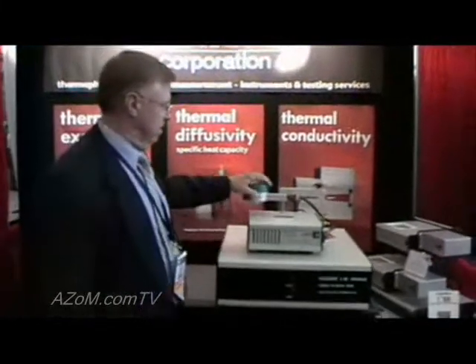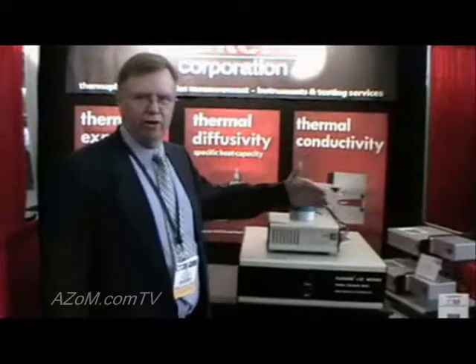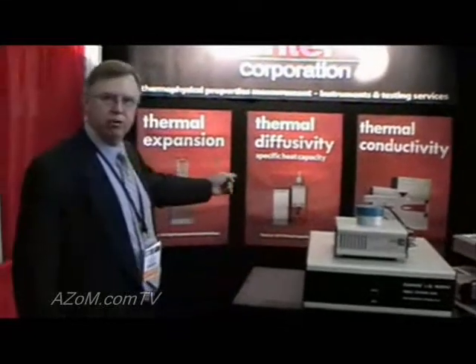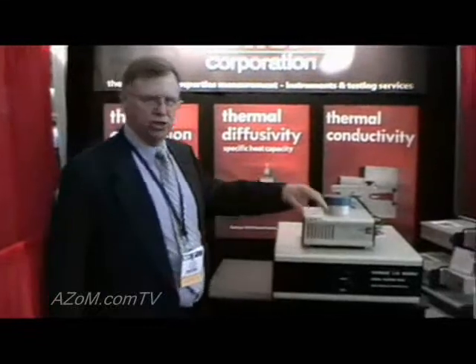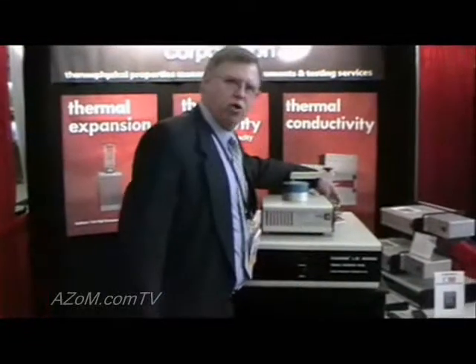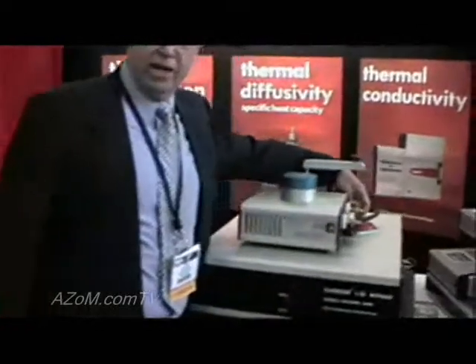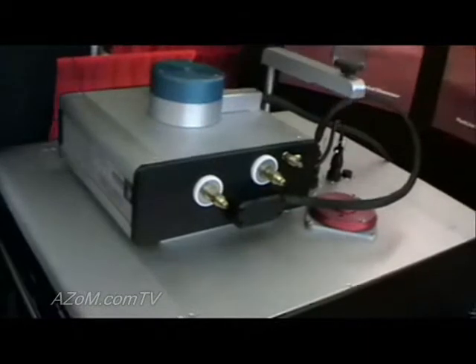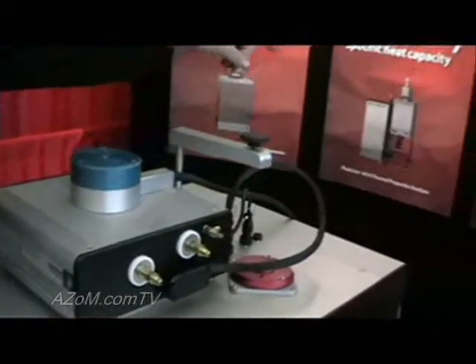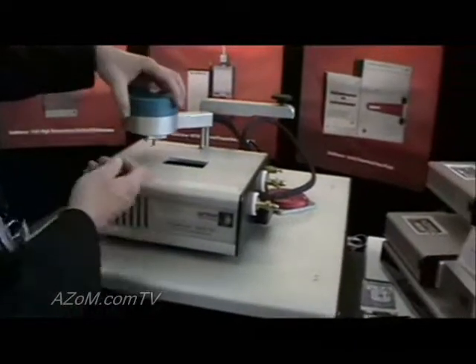It's a modular design, so we can start off with this module and add modules later, either for higher temperature — as you can see in the background, 1600°C, 2800°C. This particular one uses laser flash. You can see where our port in the back is where we connect our laser through a fiber optic connection. It provides the laser flash source, coming in through a fiber optic wand, up to the bottom of the sample from underneath to flash the sample.